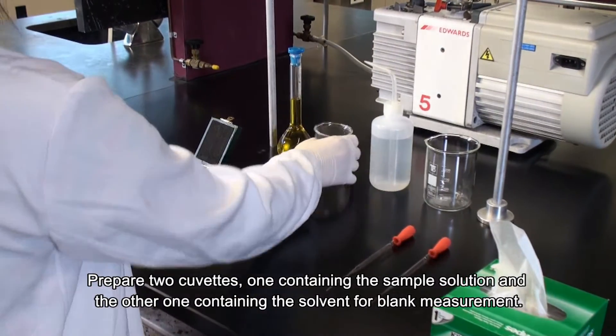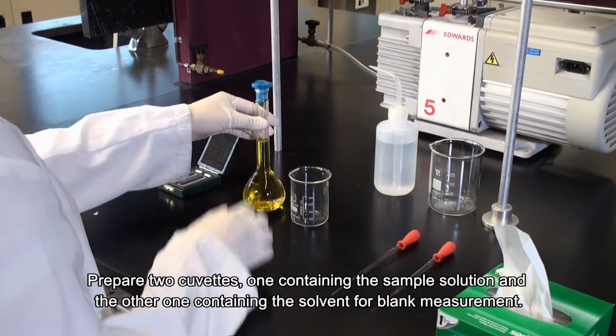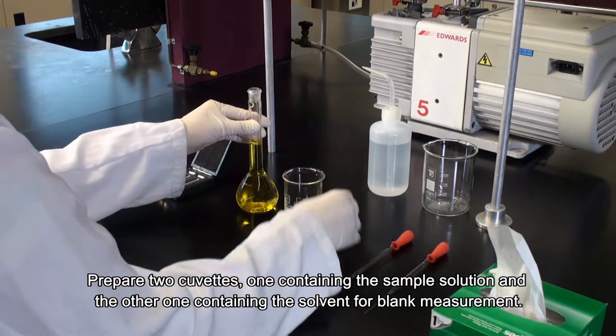Prepare two cuvettes, one containing the sample solution and the other one containing the solvent for blank measurement.